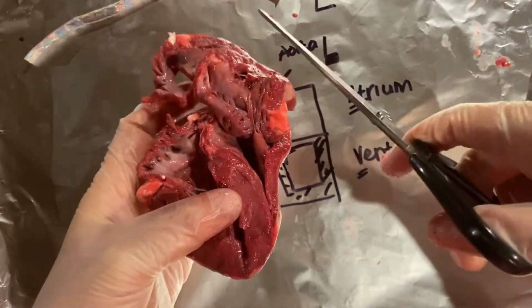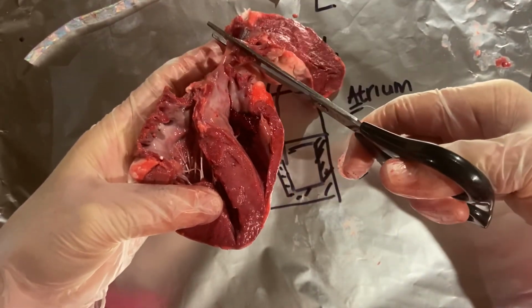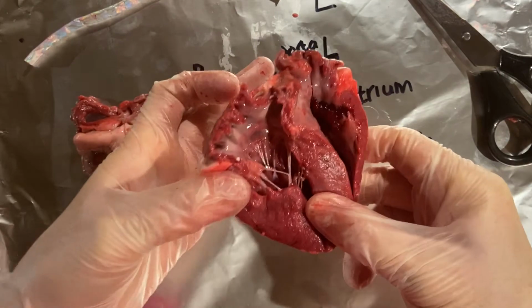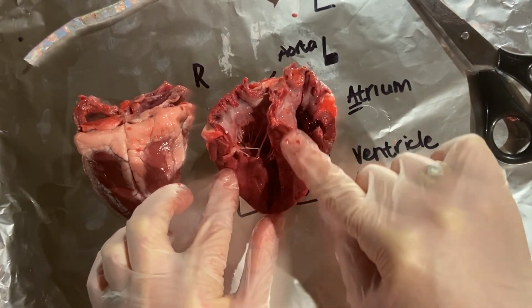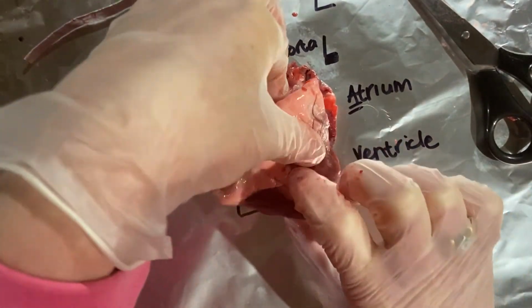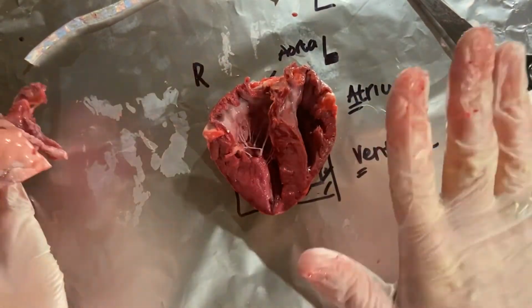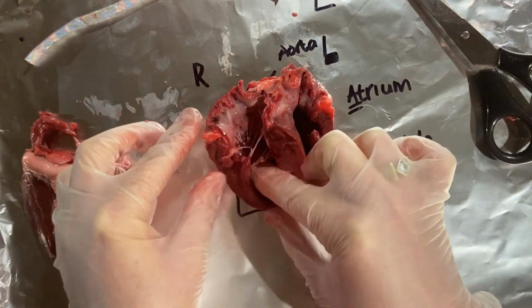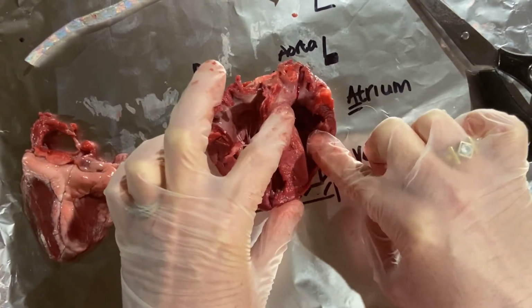Okay, let me just take that away. And I'm just going to cut that bit there away as well. Okay, right, so I'm just going to move that to one side. So there you can see, absolutely beautiful. This here is clearly the left side of the heart. If I'd taken this bit over here, it would be on this side, which is why it's on that side of the diagram. But don't worry about the sides at the moment. What I just want you to really appreciate is how beautiful and thick this side of the heart is compared to the right hand side. And there's even a little blood clot in there as well.